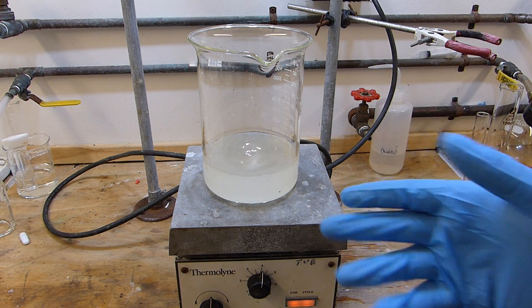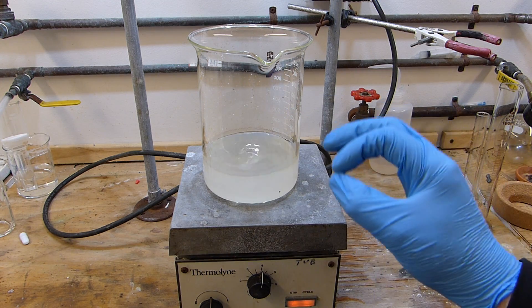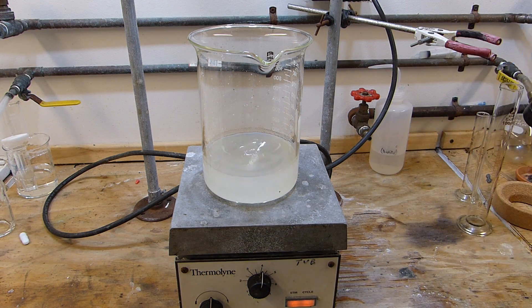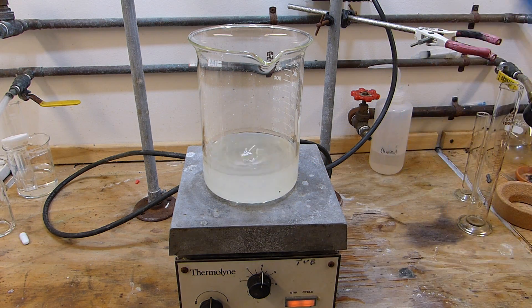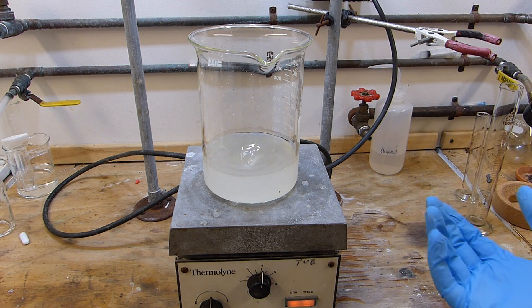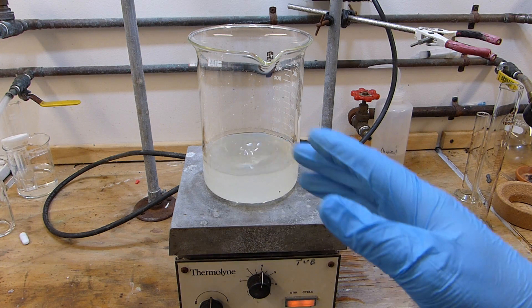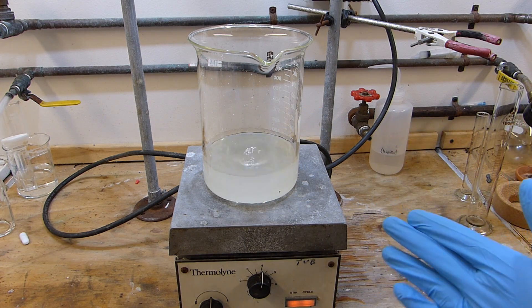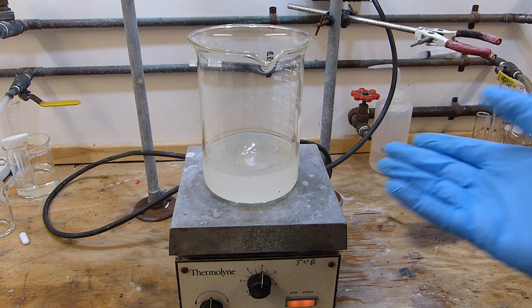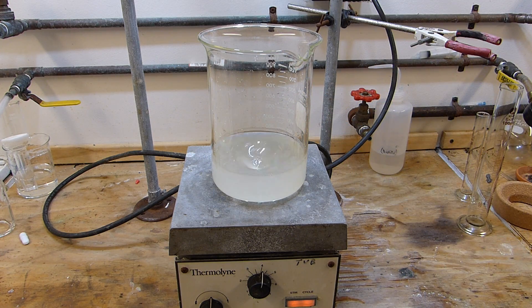Now to ensure that this goes essentially to completion, we want all the oxalic acid to be able to interact. So what we'll do is heat this up to homogenize the mixture and ensure there are no crystals left, which of course aren't going to play into that reaction. Once there are no more crystals and this is a completely homogeneous mixture, we can then cool this down in the fridge and precipitate all the dimethyl oxalate from the solution. That's simply because dimethyl oxalate is far less soluble than any of the other components — oxalic acid is extremely soluble in water, and both methanol and sulfuric acid are soluble in all proportions with water. So on cooling, pretty much the only thing that's going to precipitate is the dimethyl oxalate, which makes this particular synthesis quite easy.